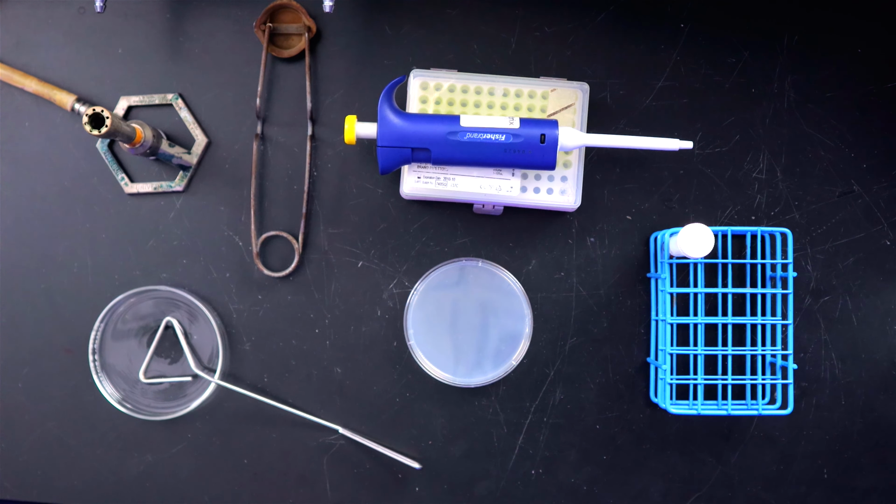Okay. And this is for spreading the bacteria, so what would you call that? Yes, so we would call this a spreader. I would have called that a bougie confabulator, but spreader makes a lot more sense than a bougie confabulator. Yeah, it sure does.